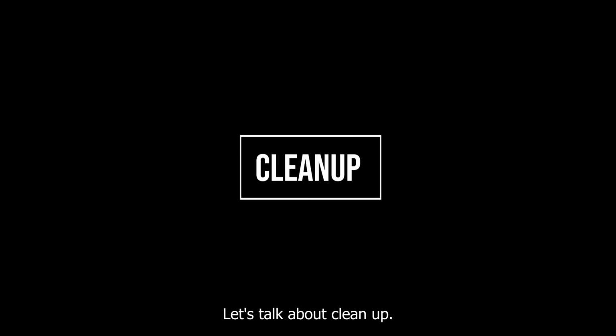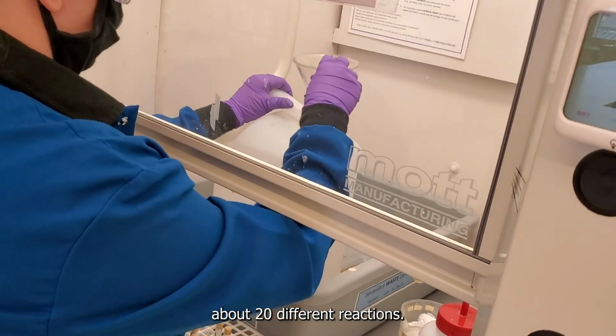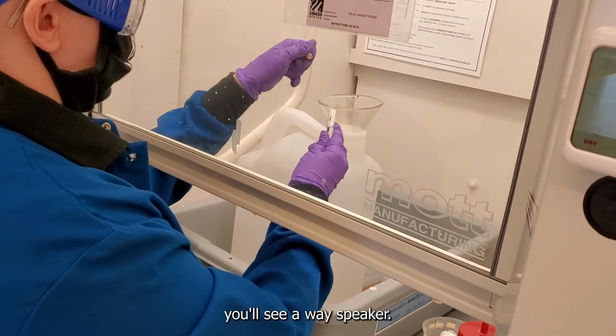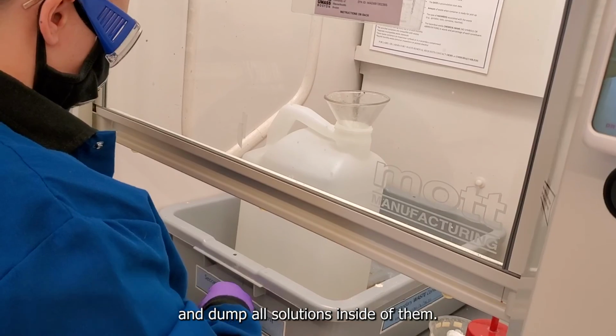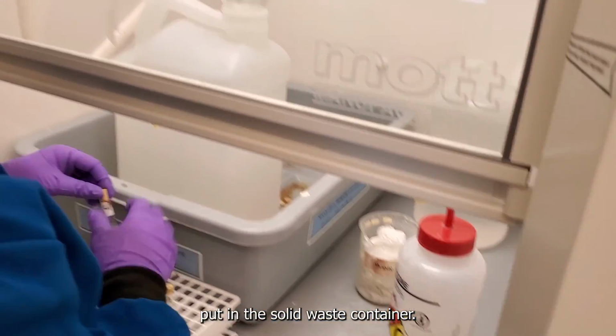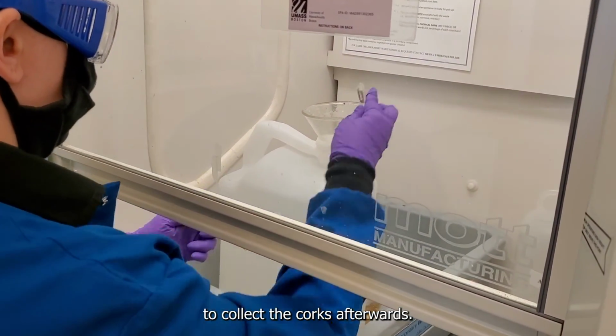Let's talk about cleanup. It's extremely essential in this lab as we've done about 20 different reactions. So, in the back, in the hood, you'll see a waste beaker. Please take your tubes and dump all solutions inside of them. The caps that you have can be put in the solid waste container. There may be a separate container to collect the corks afterwards.